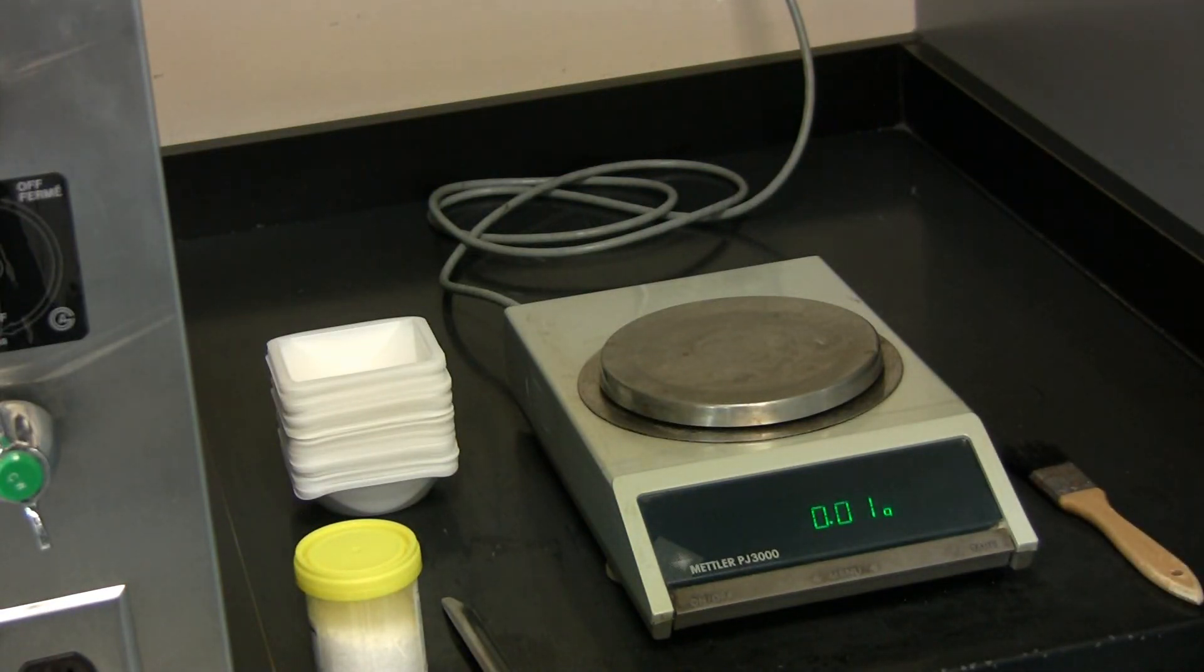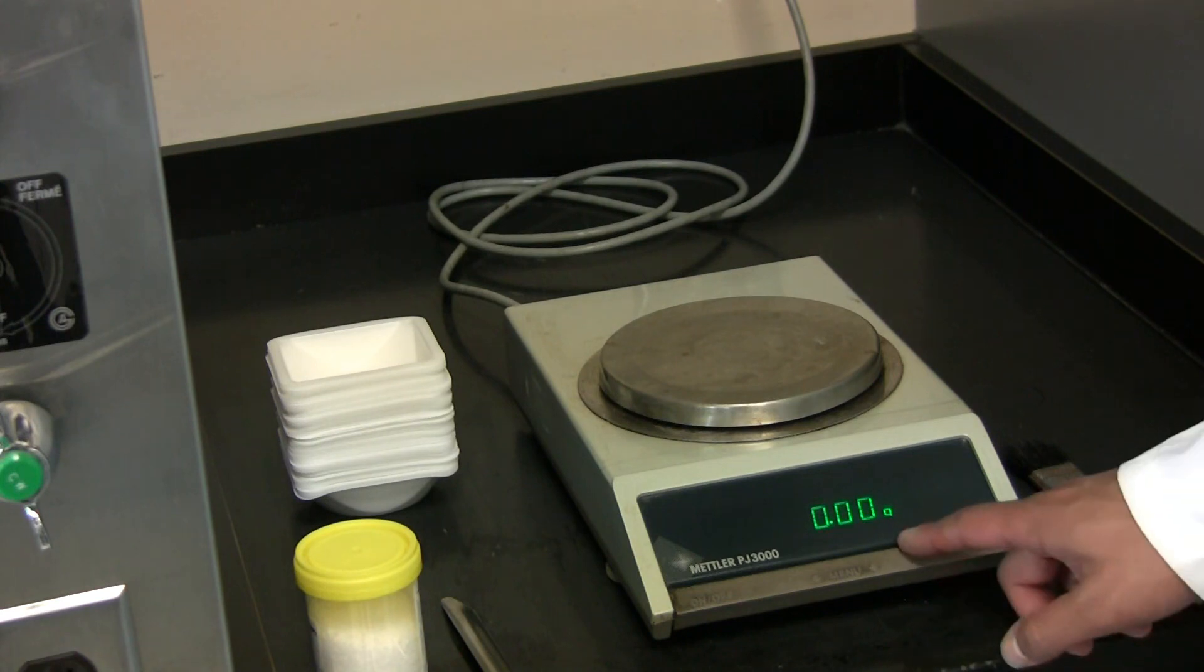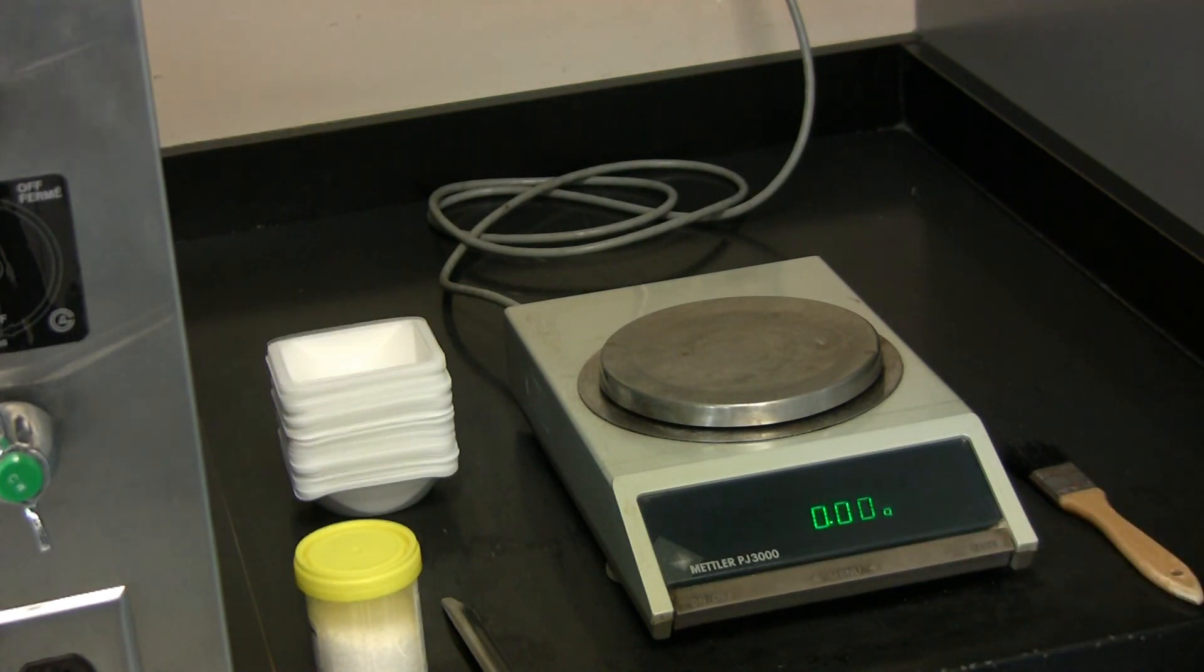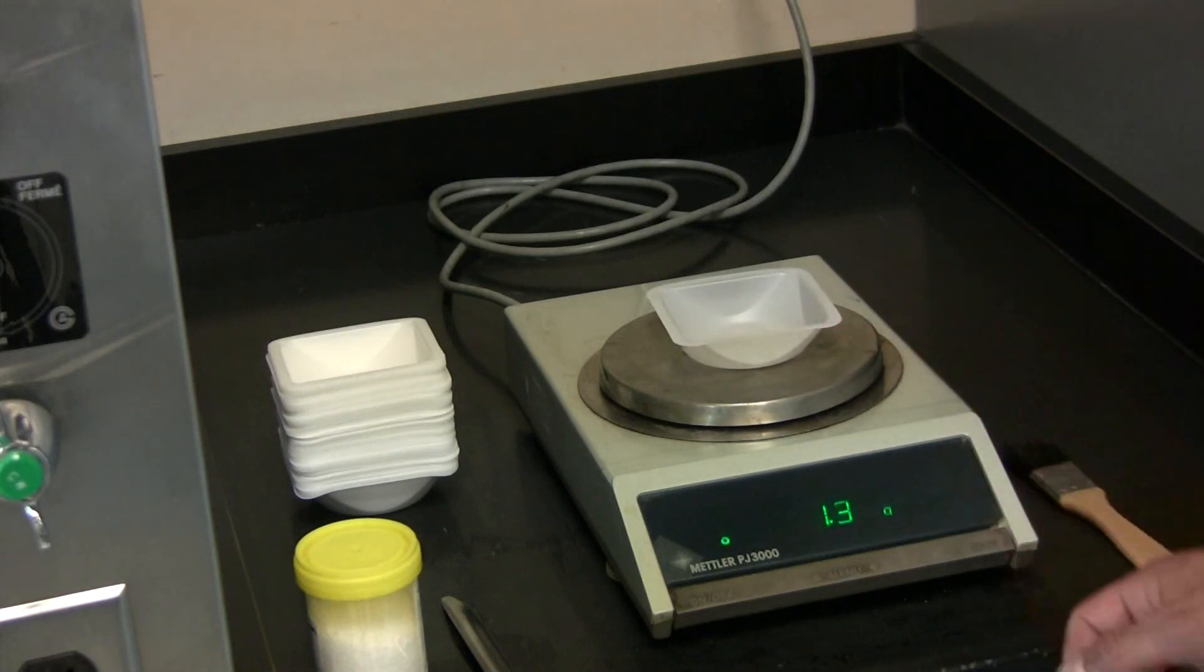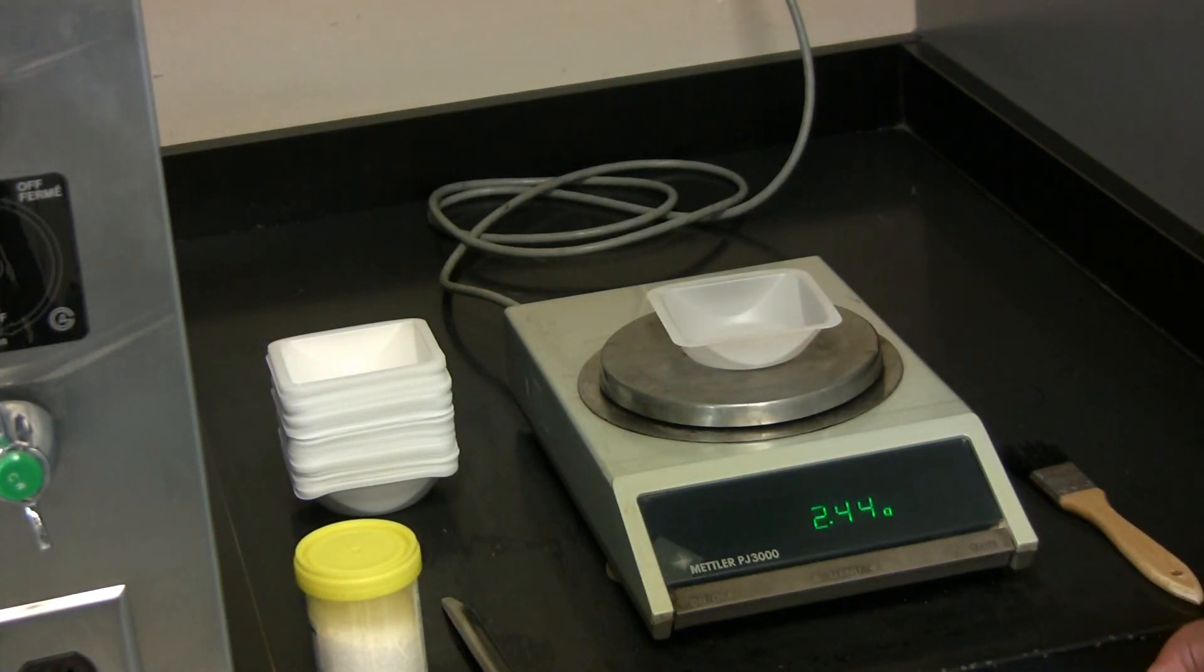After it has settled, be sure to tare it. Take your weigh boat and place it on the top loading balance. Wait for it to settle out, and then tare it.